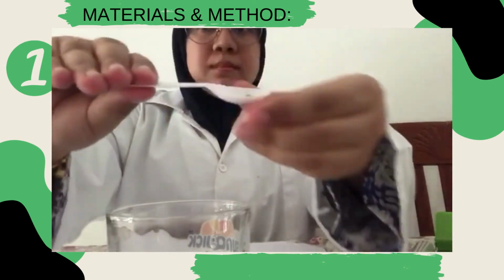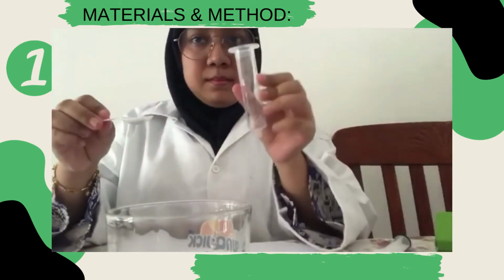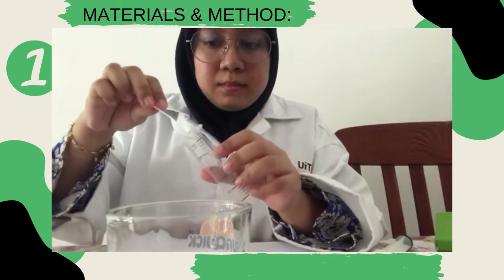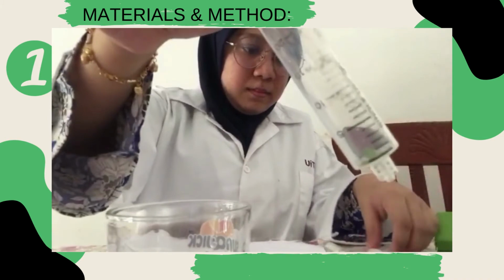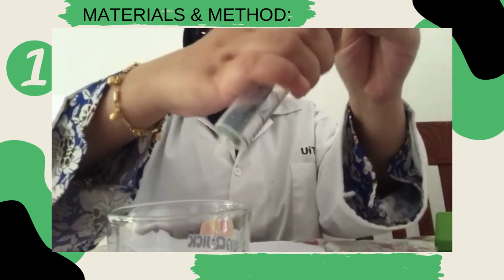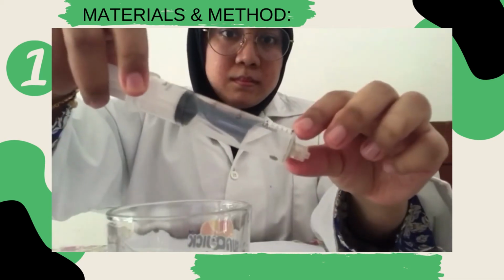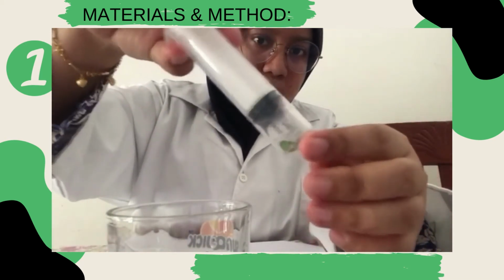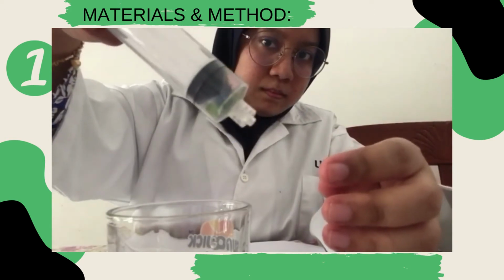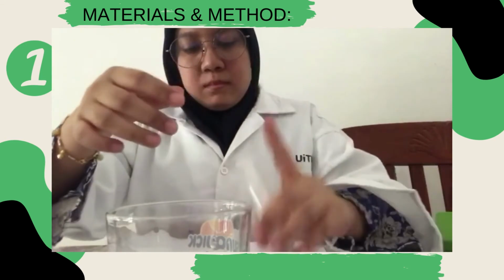After that, remove the plunger from the syringe and remove the cover from the tip. Put the leaf discs into the barrel of the syringe and tap them down to the tip. Replace the plunger into the syringe, being careful not to damage the leaf discs. Draw about 5 to 10 ml of bicarbonate solution into the syringe. The leaf discs should float in the solution.